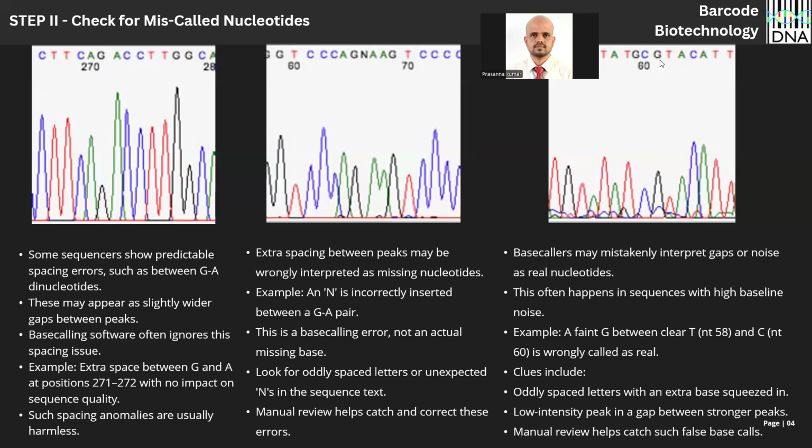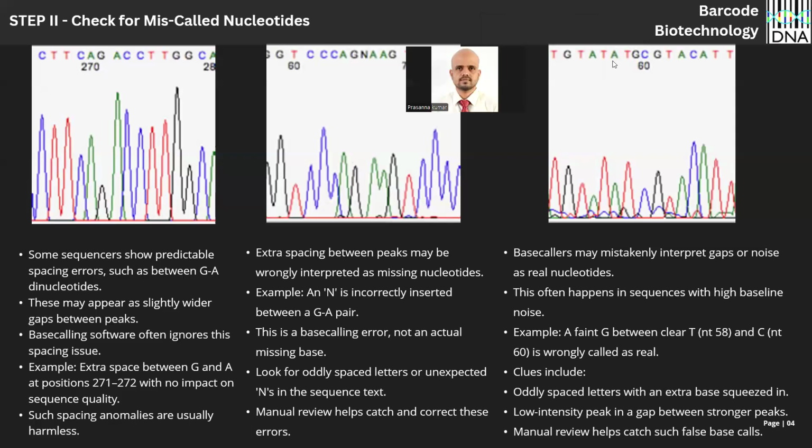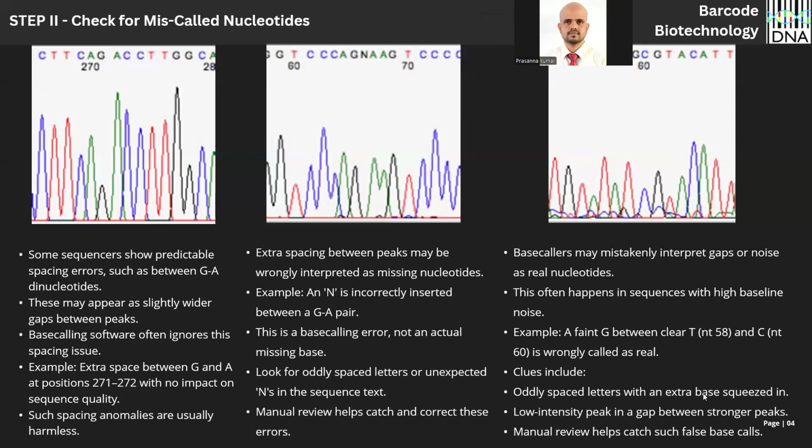See the guanine peak here in the 61st position. It should be like this. Here there is definitely no guanine. So this should be carefully eliminated. That's what I told you. Better look for evenly spaced peaks when you are generally checking the chromatogram in one go. Okay.